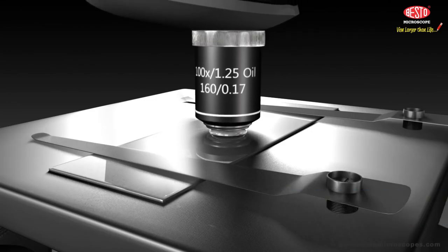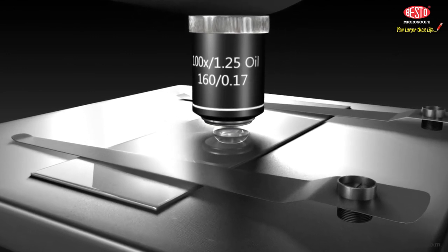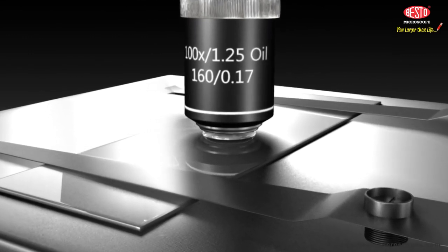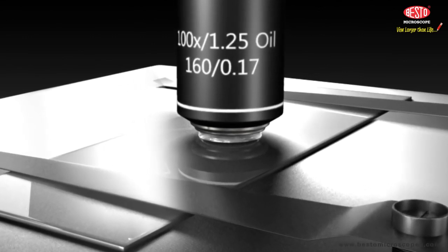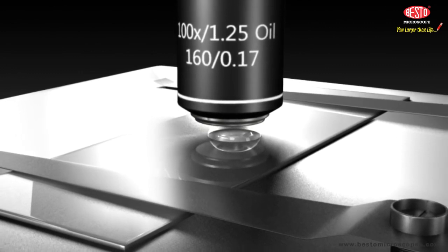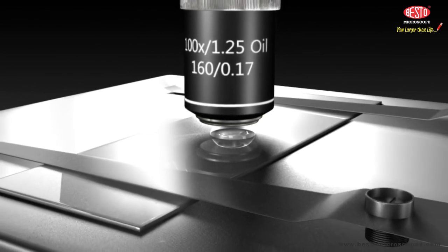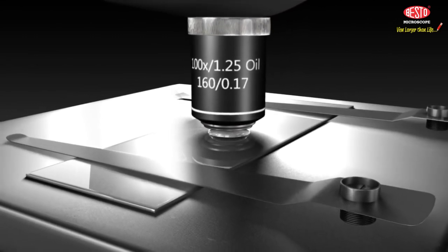Step 11. Medical microscope model Besto 10 has a special type of lens called an oil immersion lens, 100x. This lens is used by placing a drop of oil, cedarwood oil, on the top of the cover slip and adjusting the position of the front lens of the objective so that it is touching the oil drop. The oil bends the light more than the air would, so more light can enter the microscope. Oil immersion lenses make it easier to see samples because they increase the amount of light going through the sample or slide and microscope and into your eye.